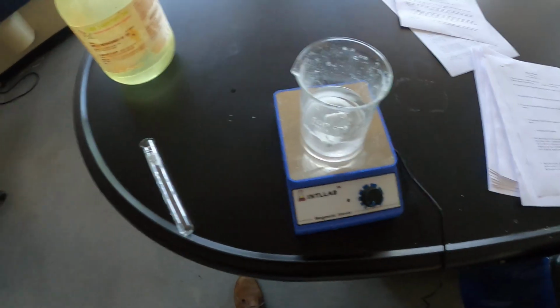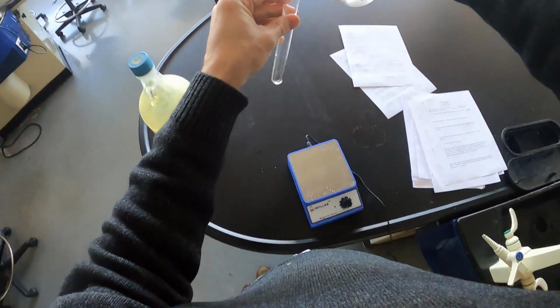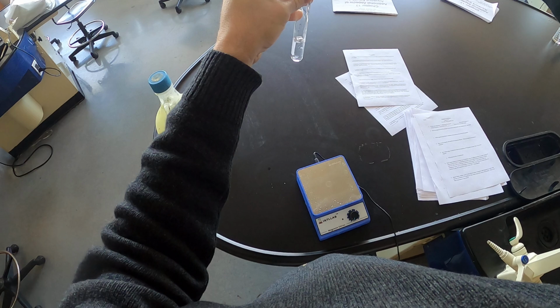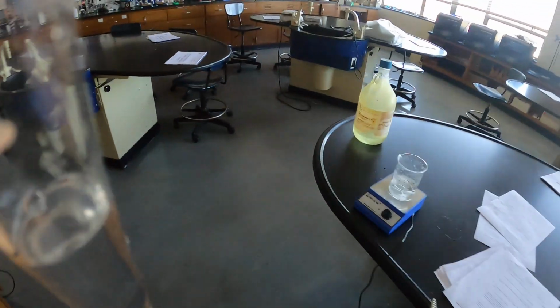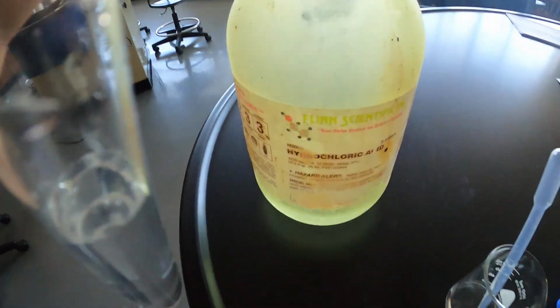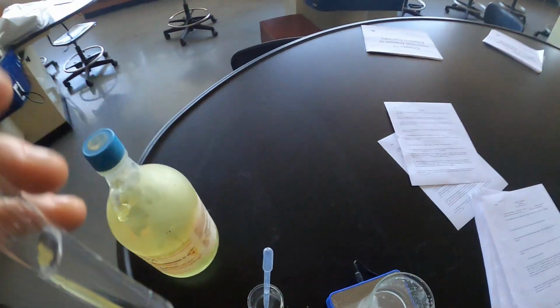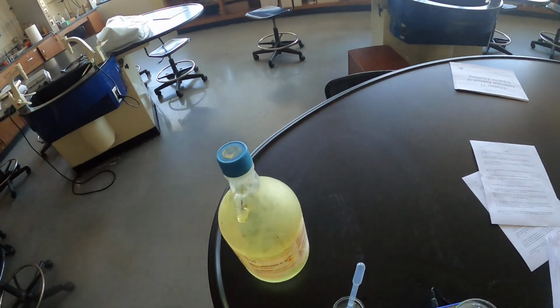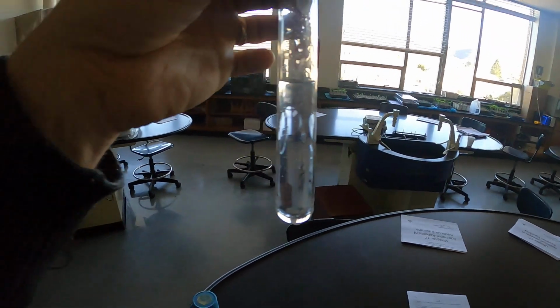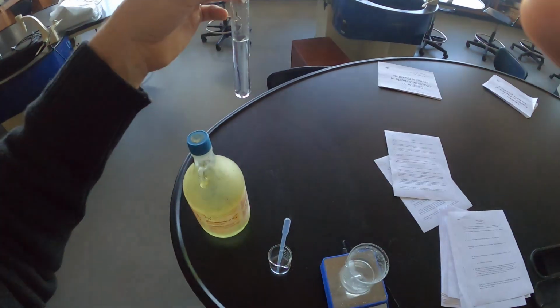So we can easily demonstrate this one by essentially taking this concentrated NaCl, adding some to the tube, and then I have strong HCl in the bottle right here. So by the addition of HCl, which we know is a very strong electrolyte, there is a lot of Cl- ion already present in this solution, but it's getting ready to be added to a solution that is essentially already at its capacity for Cl-. So let's take a look here.